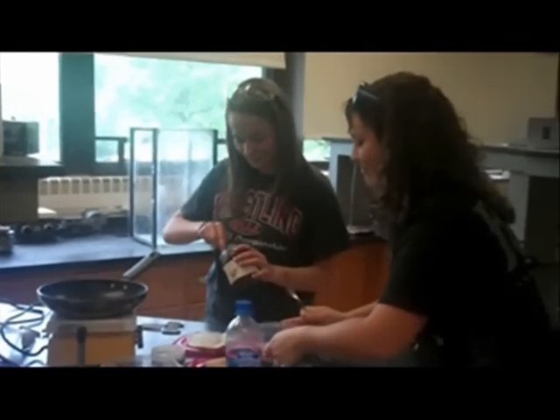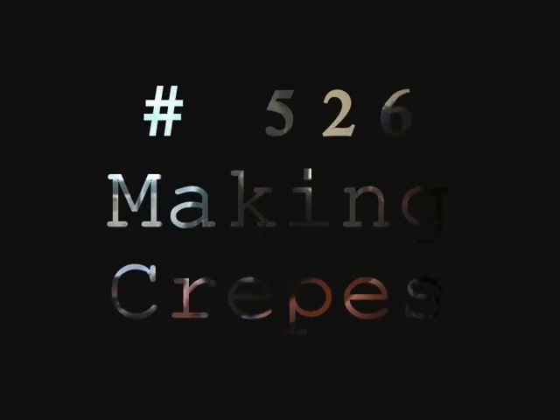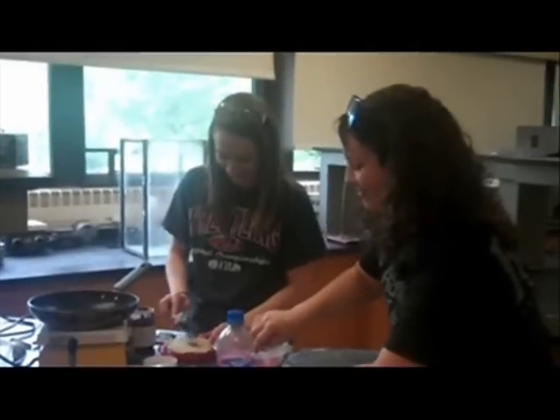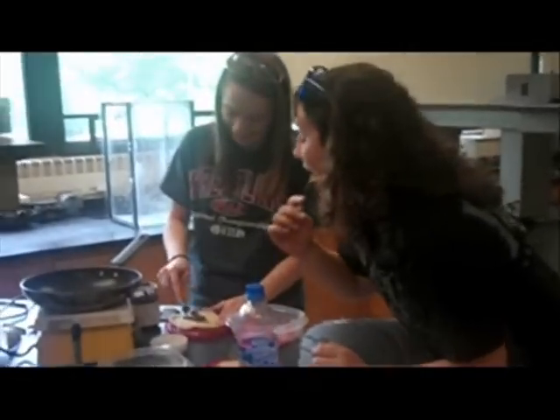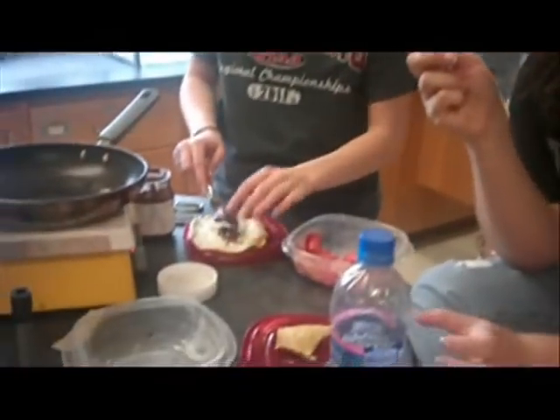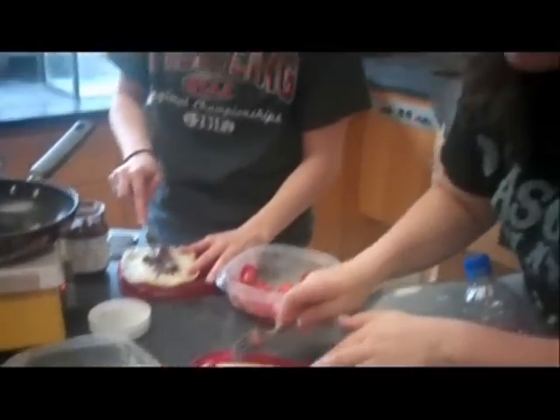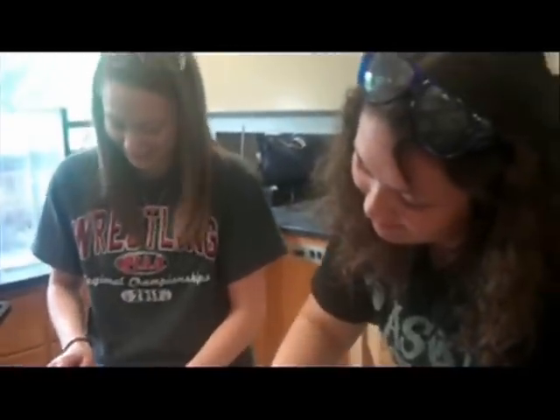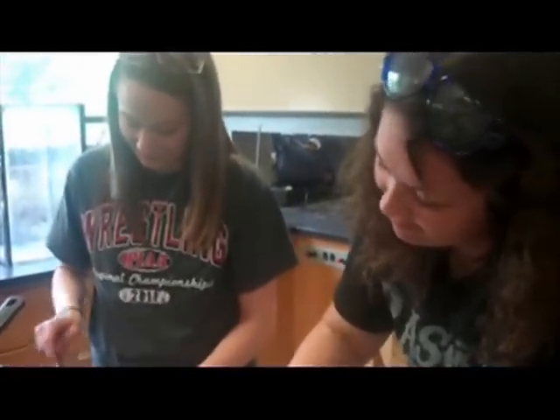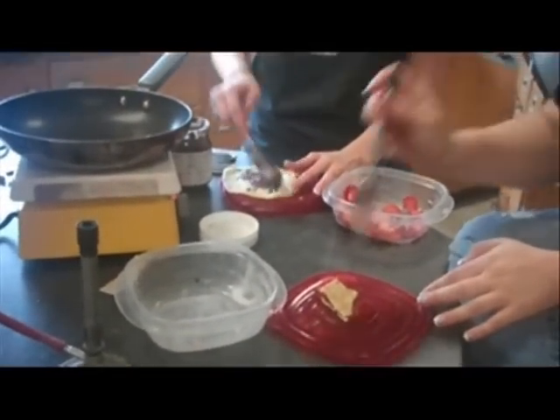What not to do in the chemistry laboratory environment. Rule number 526: making crepes. Although they look delicious, this is a potentially hazardous situation which can have dire consequences for both the girls and the teacher. Can you list some of the safety hazards and violations? Good.